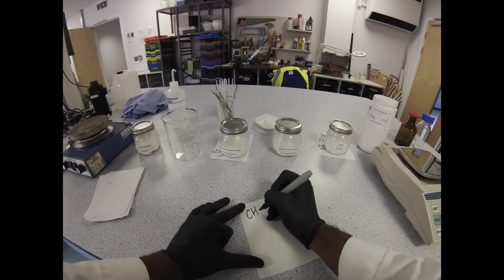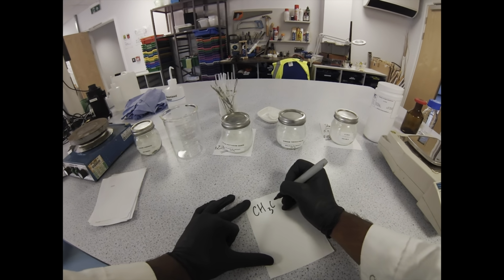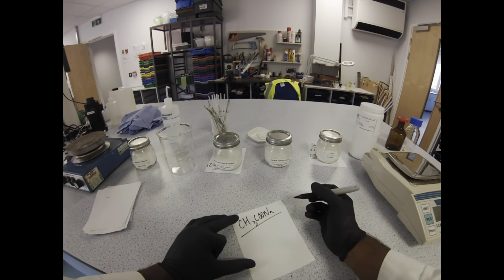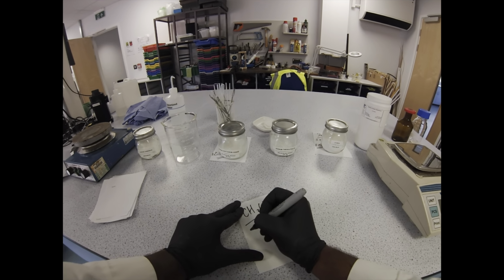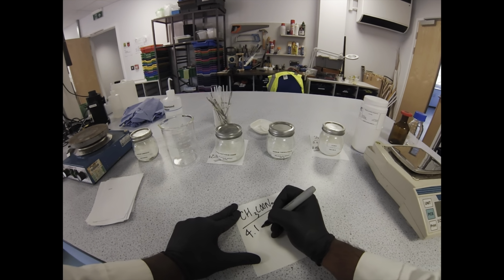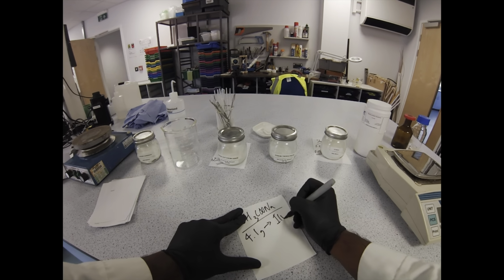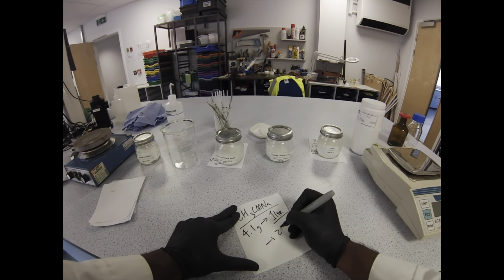The next up is our sodium acetate. I'm going to be using anhydrous sodium acetate for this, but you can use hydrated and you just have to adjust accordingly. It's going to be part of our buffering system, which is going to keep hydrogen ions available to supply to the reaction. We're doing 4.1 grams for every litre. So for 250 ml we'll halve it and halve it again.